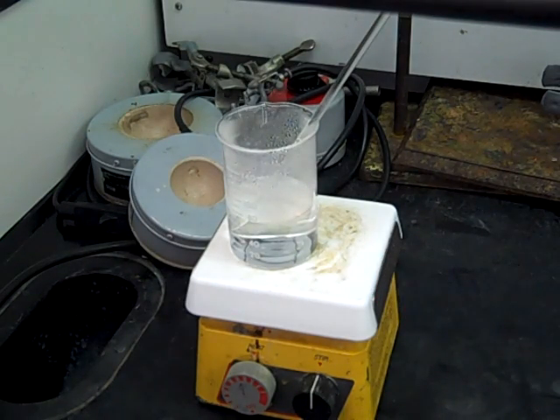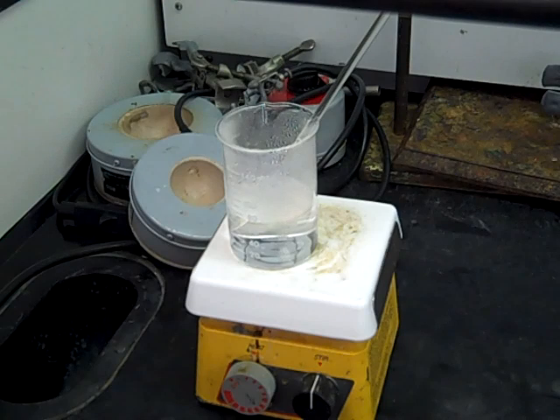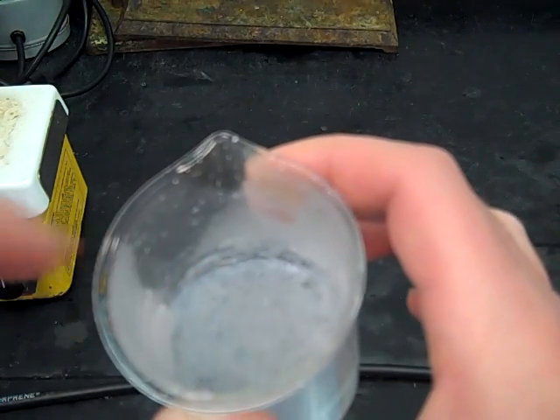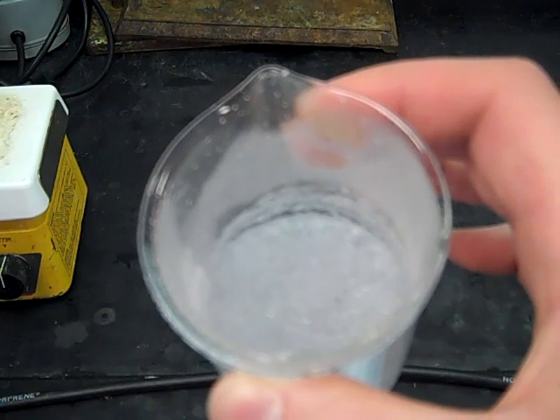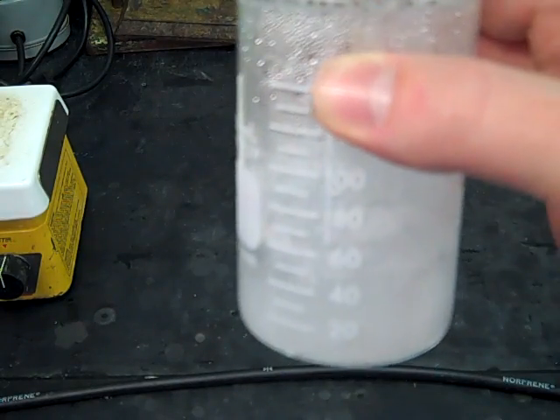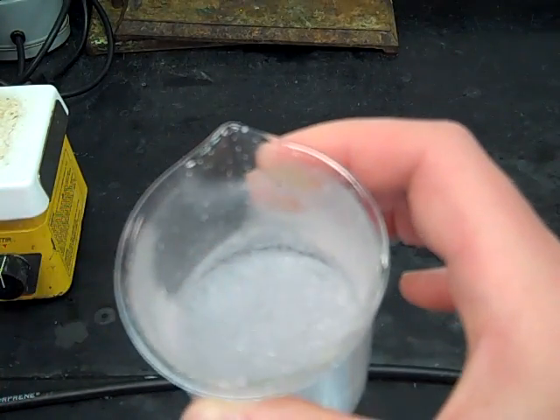Once this is all dissolved, turn off the hot plate and let it start to cool down slowly. It's that slow cooling process that's going to allow purification of your desired unknown solid. Let it cool down to room temperature, and as this is cooling you're going to notice that crystals are starting to form — you can kind of see on the surface there those crystals slowly forming. Those are purified crystals of your unknown solid. Any soluble impurities in this solvent will remain in the liquid while our solid recrystallizes out.